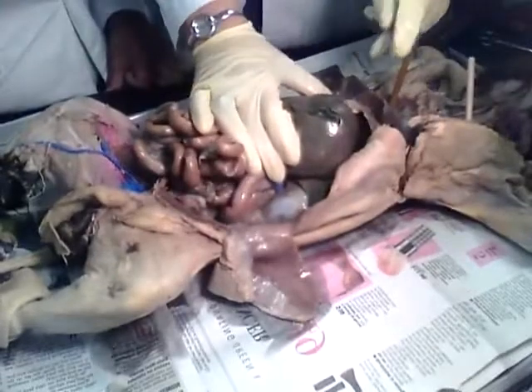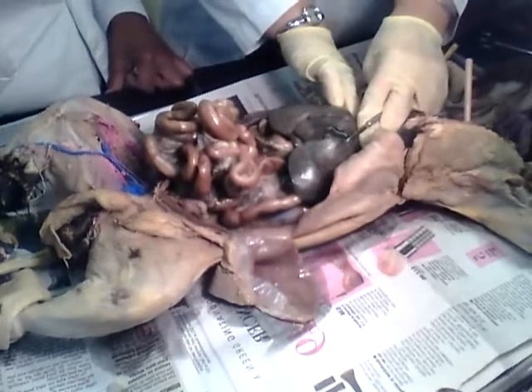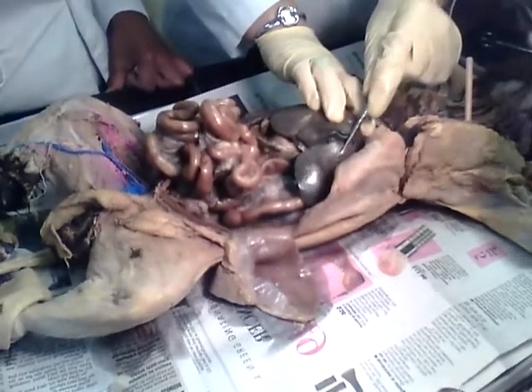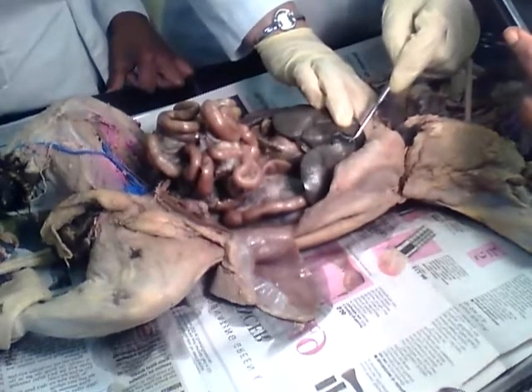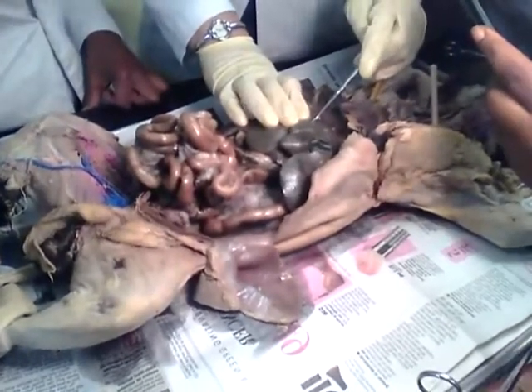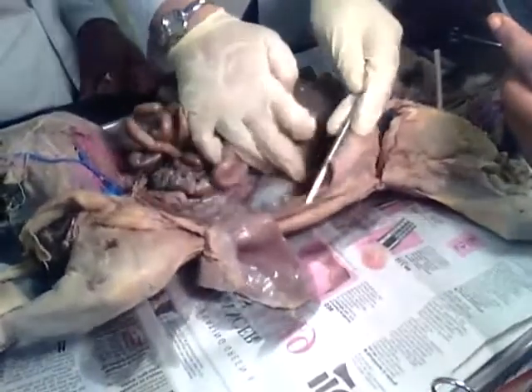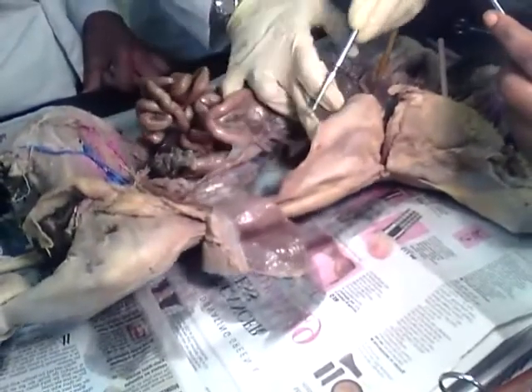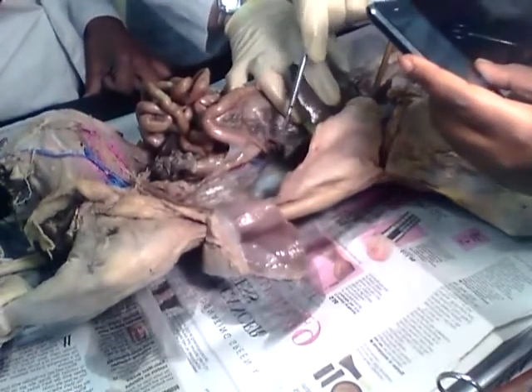What's the name of this organ? The liver. Now, the liver in the cat has how many lobes? 5. Which is this lobe? Right medial lobe, and it houses the gallbladder. Very good. Then if this is the right medial, then this must be the left medial, and then the left lateral. And then here we're going to encounter the right lateral, and then the caudate. Very good. The caudate, like the tail, right?